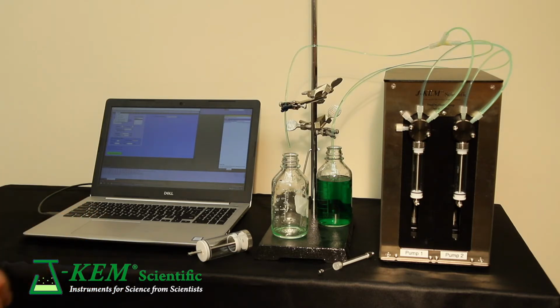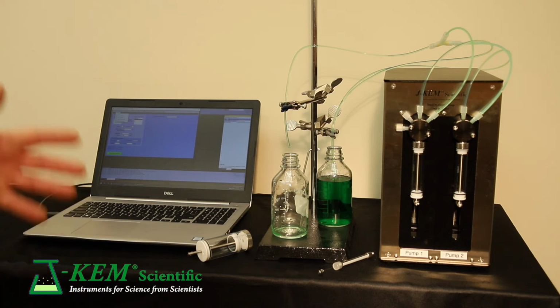Then under program control, you could say go to port A and withdraw 25 milliliters of something and add it to my reactor. And then you could say go to port B, which would be your second solvent, withdraw 5 milliliters and add it to my reactor. And then port C and D and so on like that. So any of the ports you can use for addition or withdrawals completely under program control.